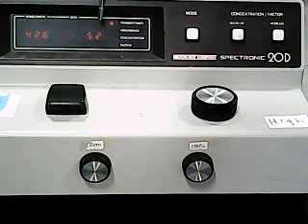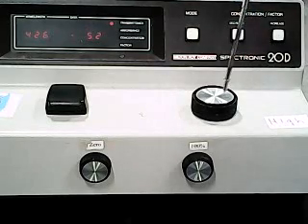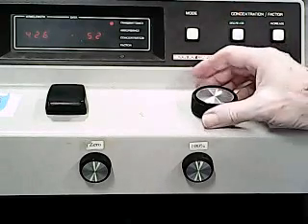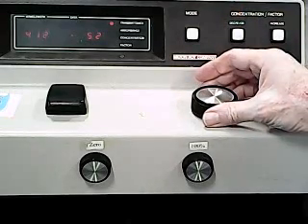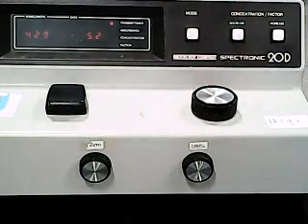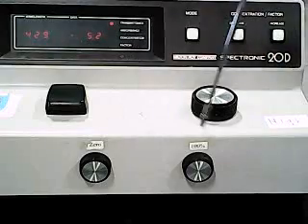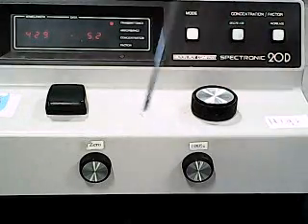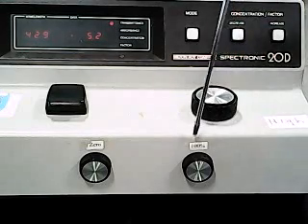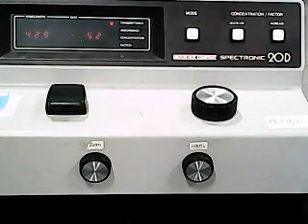This is reading either absorbance or transmittance, depending on what mode the spectrometer is in. On the right side of the deck, we have the control for the wavelength. Turning this knob changes what wavelength the instrument is looking at. Down in front, we have the two adjustment knobs. The 0 adjust for when there is no light going through the instrument, and the 100% adjust for when 100% of the light is passing through the instrument.